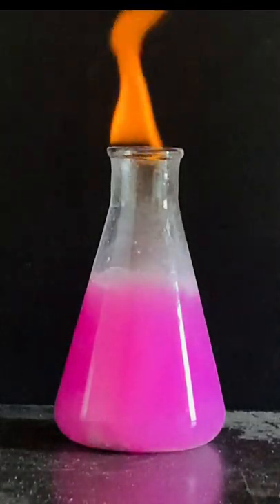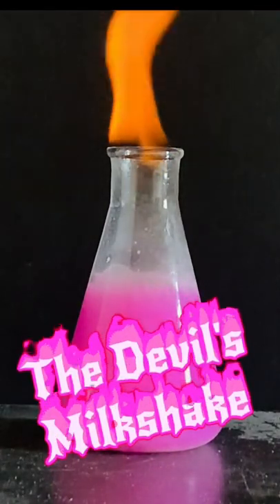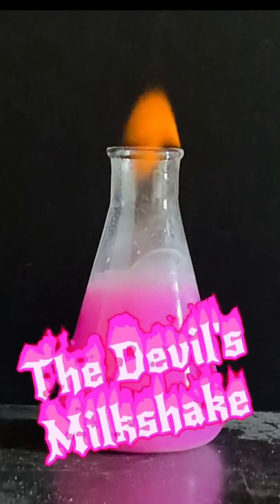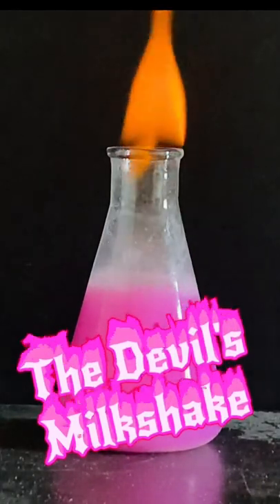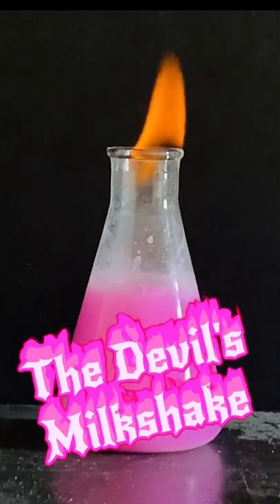I like to call this experiment the devil's milkshake. Strawberry flavored, of course. This chemical reaction seems like it's straight out of Harry Potter. Welcome to potions class.